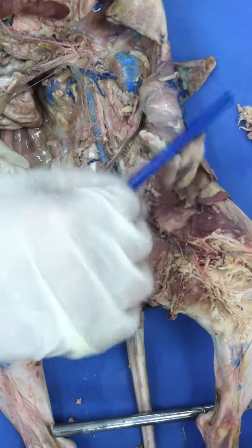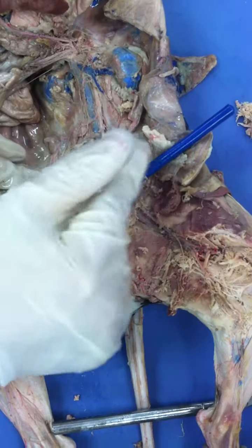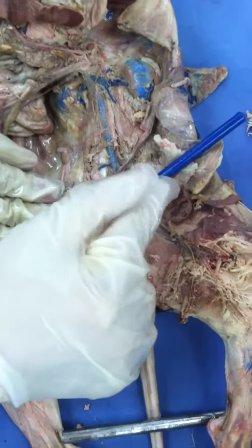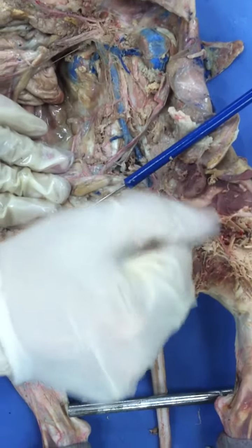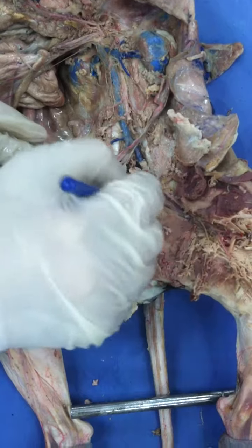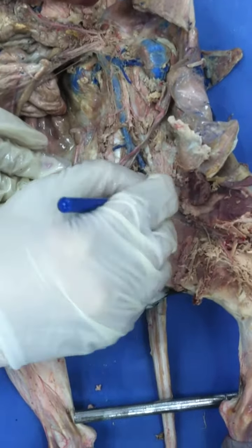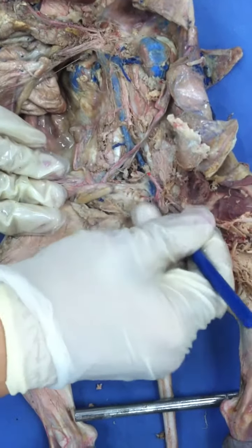Remember, you have to draw an imaginary line so you'll know where. From here to here is the inguinal or the groin region. From here to here is the external iliac. When it goes down, it's called the femoral, right? So the external iliac is the one that brings it out, right? Exactly. Now, before it branches out, the femoral gives me a deep femoral.